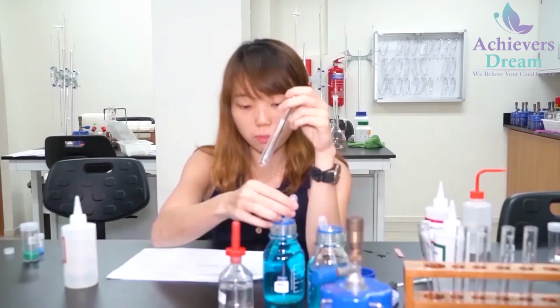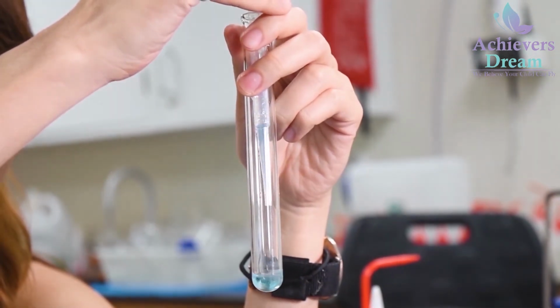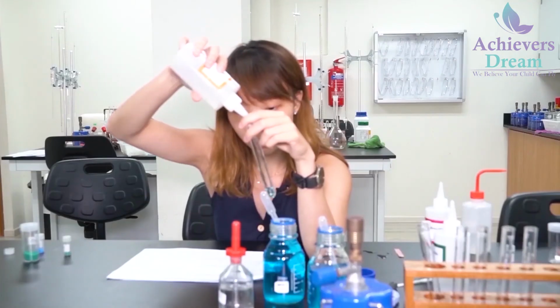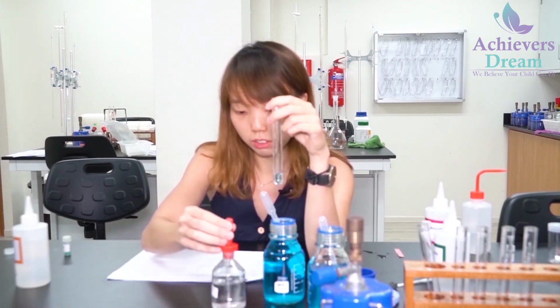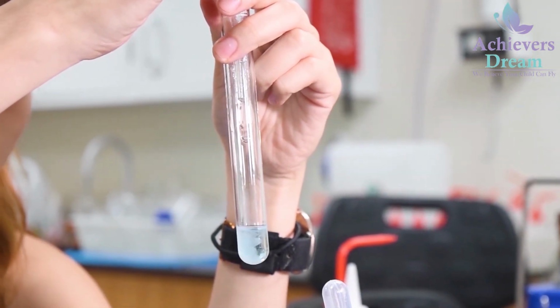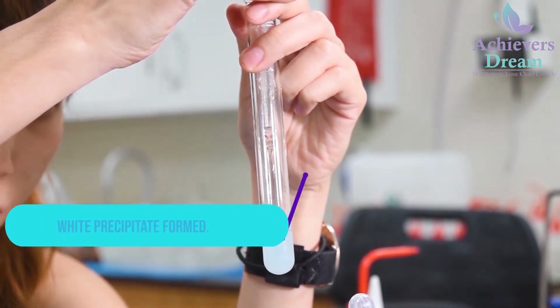Now I'm going to do the same thing for solution Q. So add 1 cm cube, followed by nitric acid, and now add barium nitrate. Upon addition of barium nitrate, you notice that there is white precipitate formed.